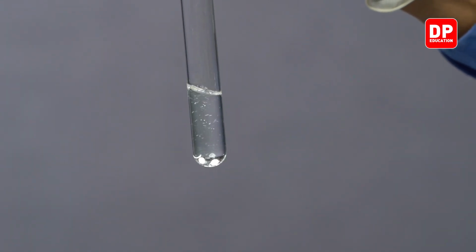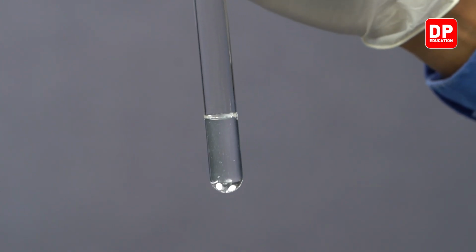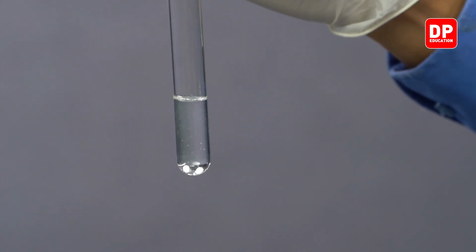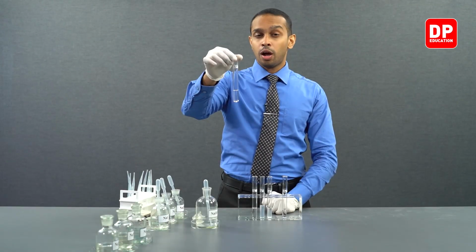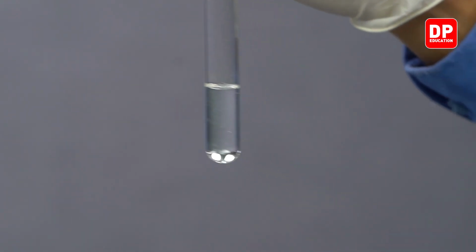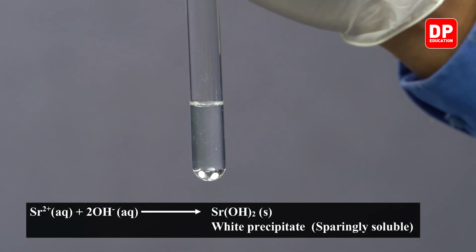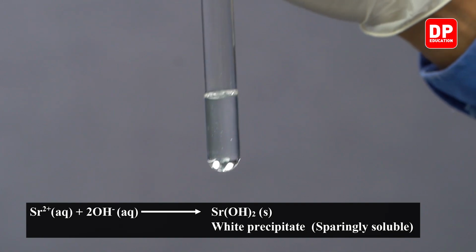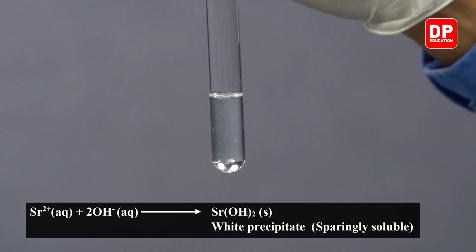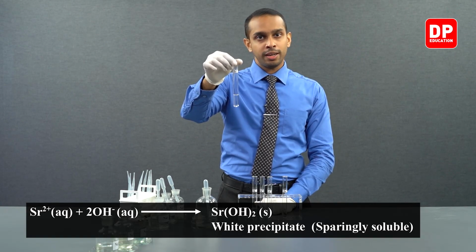As I told you before, solubility of group 2 hydroxides increases down the group. However, strontium hydroxide, which is formed here when we react strontium 2 plus aqueous ions with hydroxide ions, is not completely soluble in water.